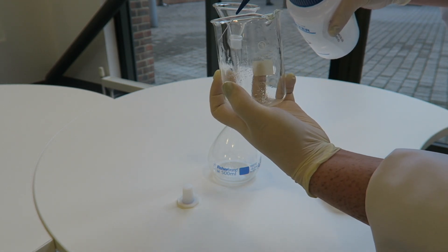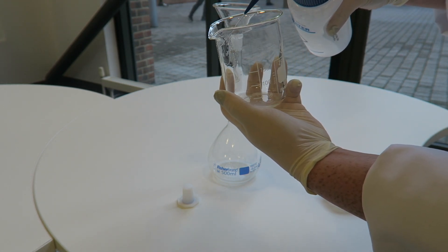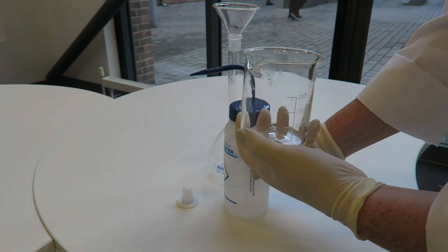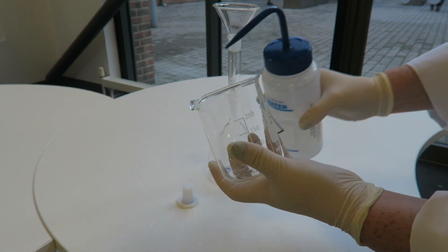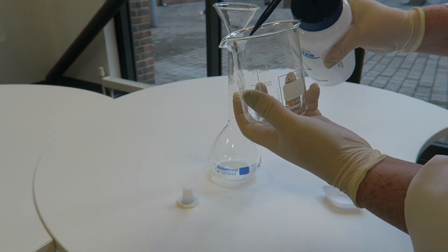Rinsing around the sides of the beaker, giving a swirl, transferring in there. I'm just doing this again, doing this a few times.